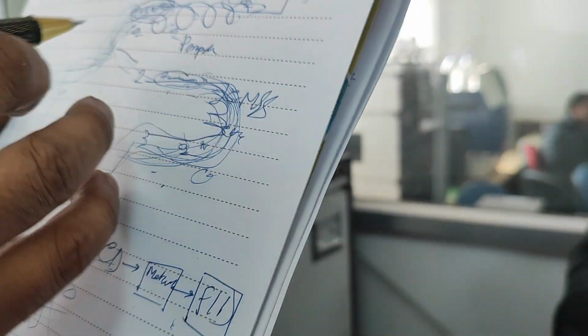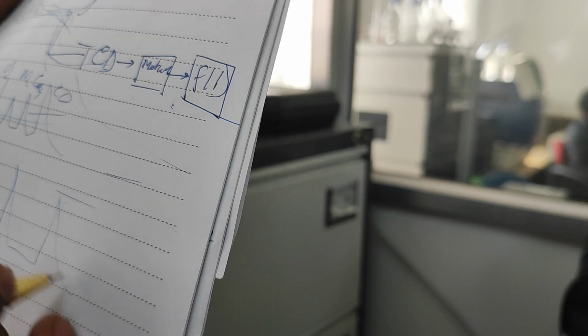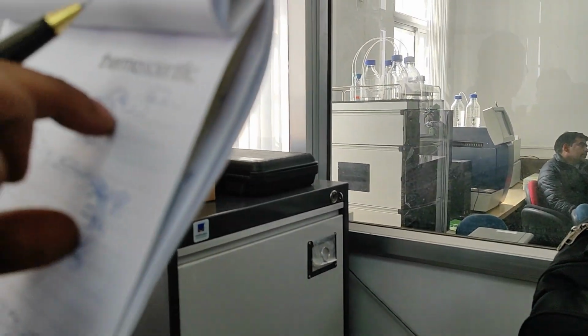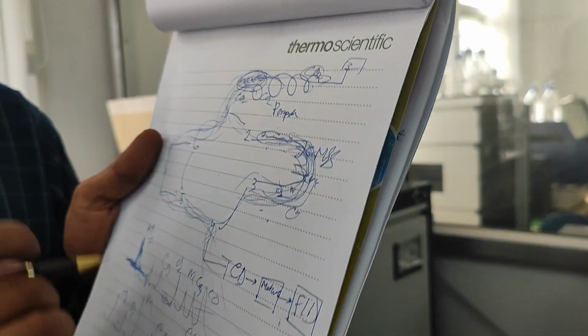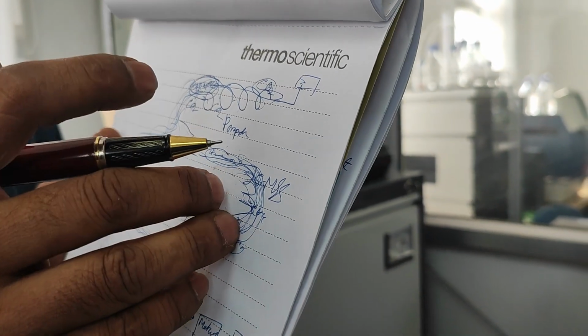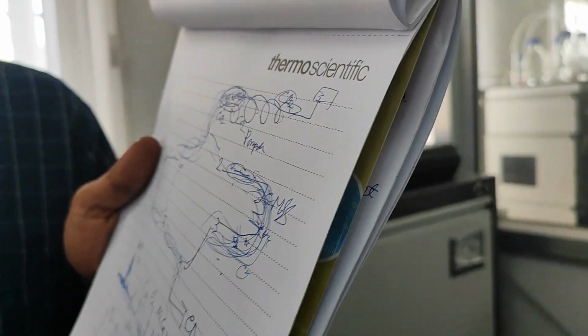CH4 and CO, then remove CO2 from here, then release methane and CO. Model 3. So many models can be used, depending on the column's length. If my molecular sieve column is very lengthy, that time all the components can be trapped. You can release CO2 first, then release these components one by one.